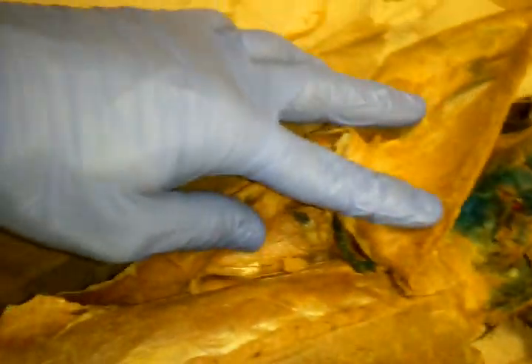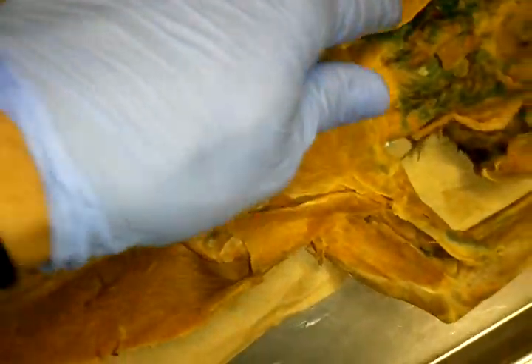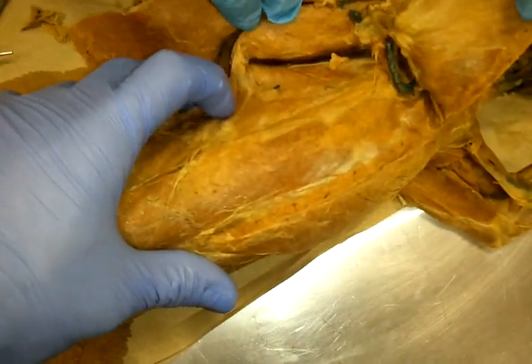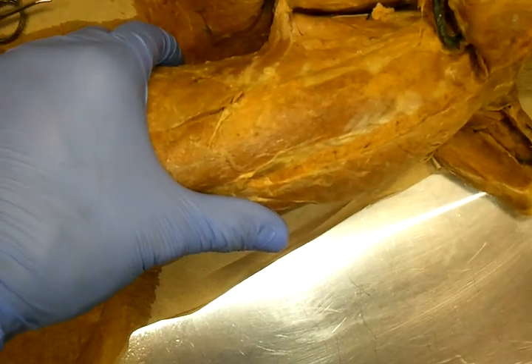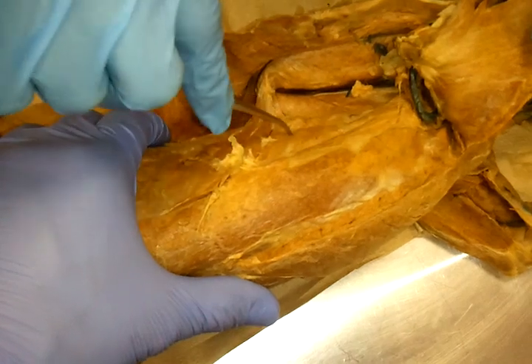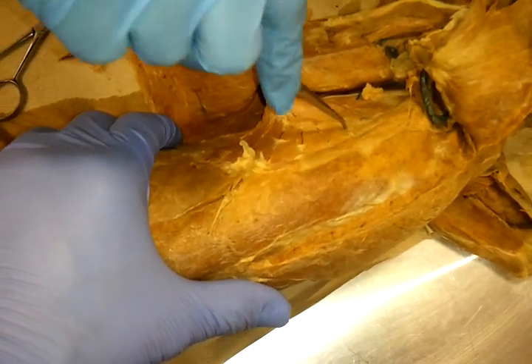I removed this over here, and then you have some scalenes in there but we're not going to go over those. And this one right here is the serratus ventralis. You can see that it is serrated — it even has a little fascia and fat between them.